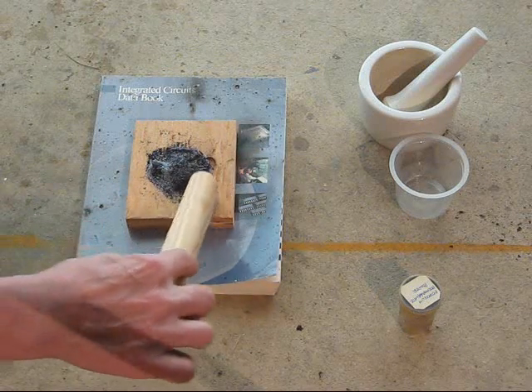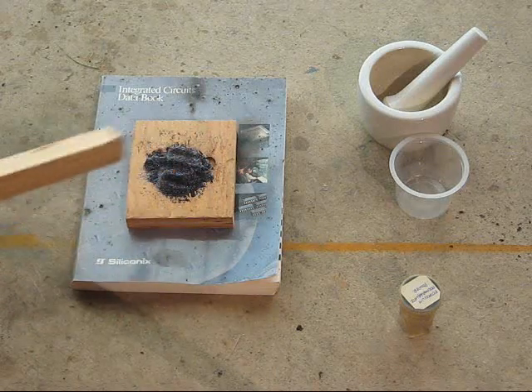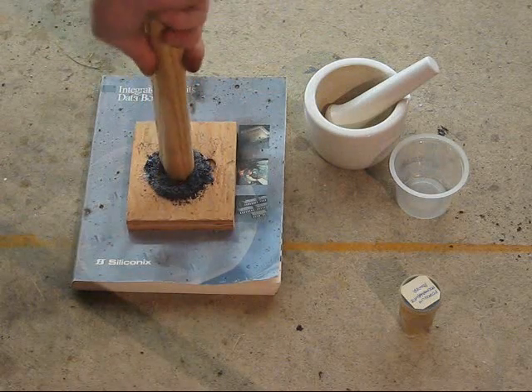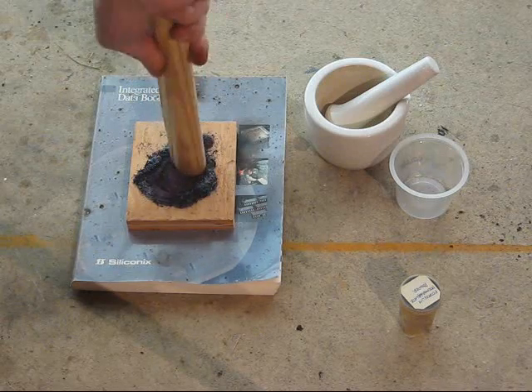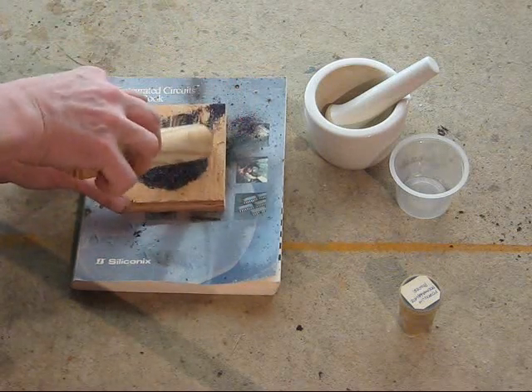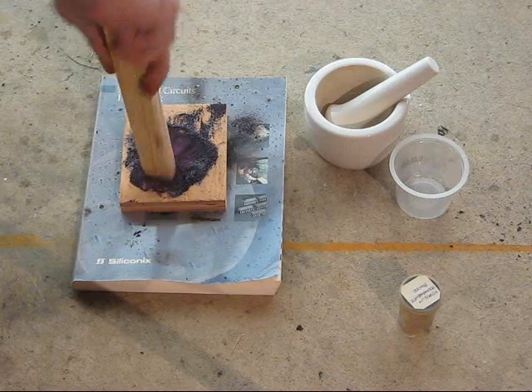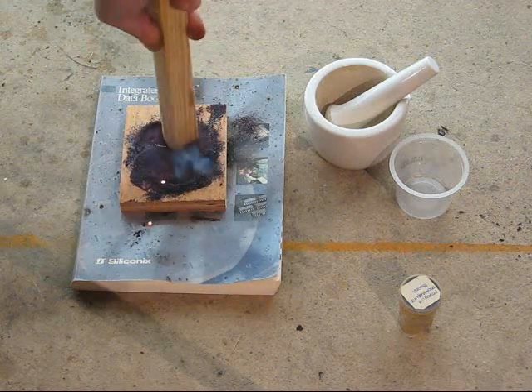Now, let's say you wanted to make a finer powder of this, and you dumped the whole mess into your mortar and started pestling it — watch what happens. This is just wood, not ceramic. There it goes.